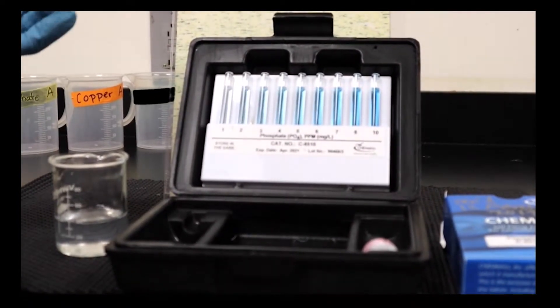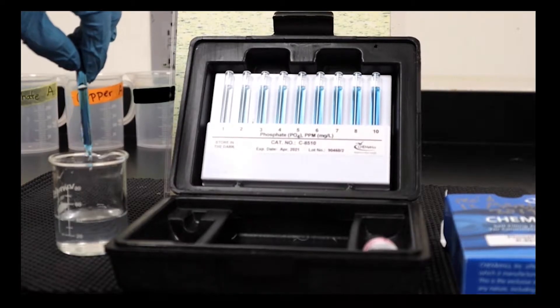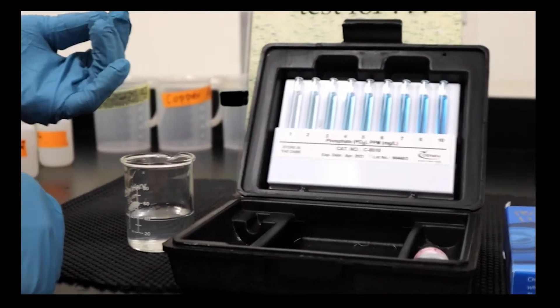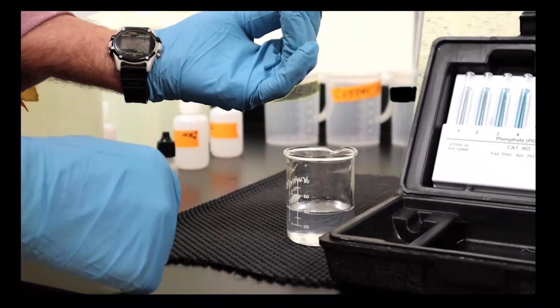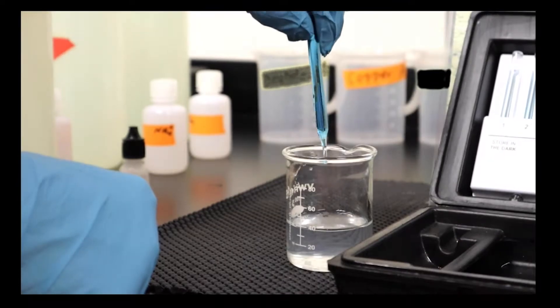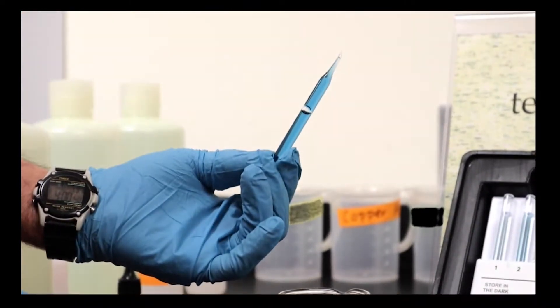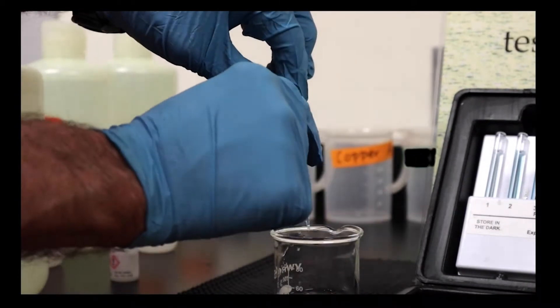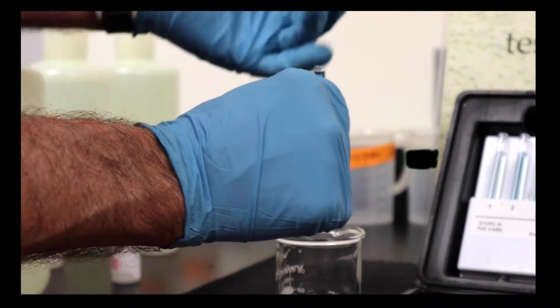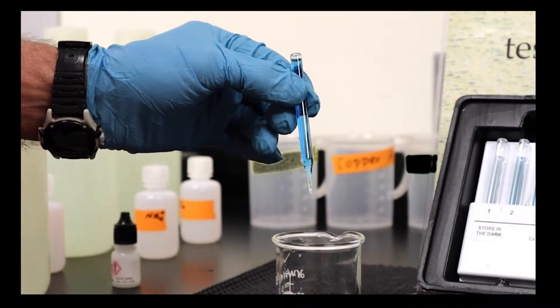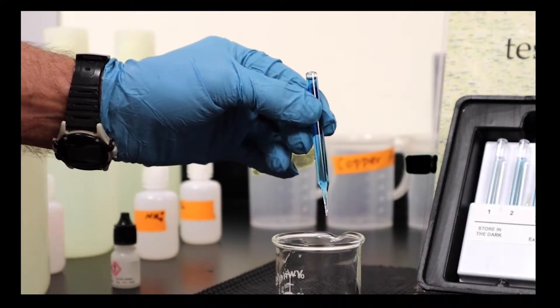The other thing about this analysis is it takes a little bit of time for the color to develop. We need about two minutes for this color to develop. We're at about a minute now and we'll give it just another minute, then we'll take our reading.